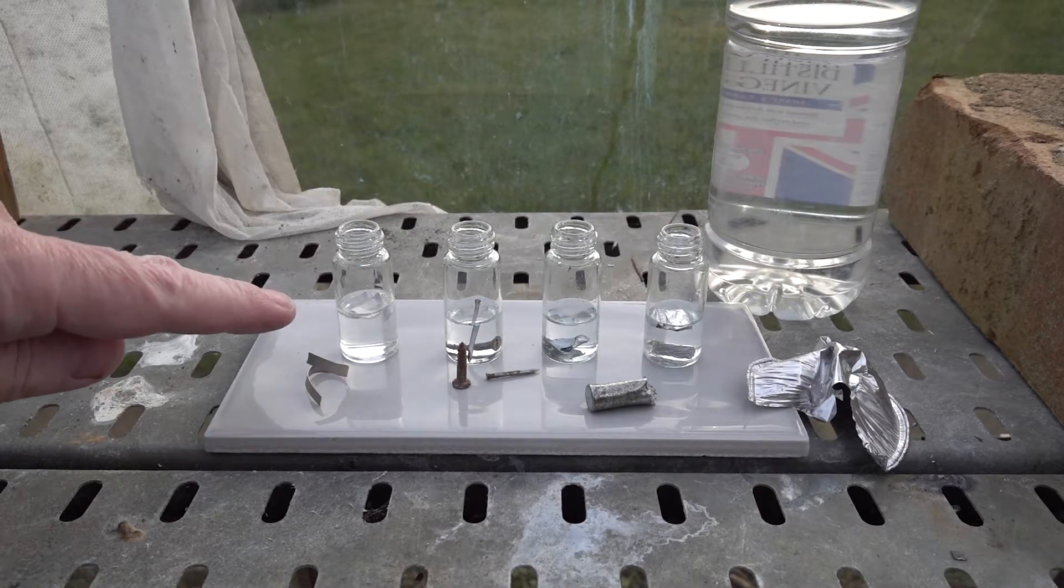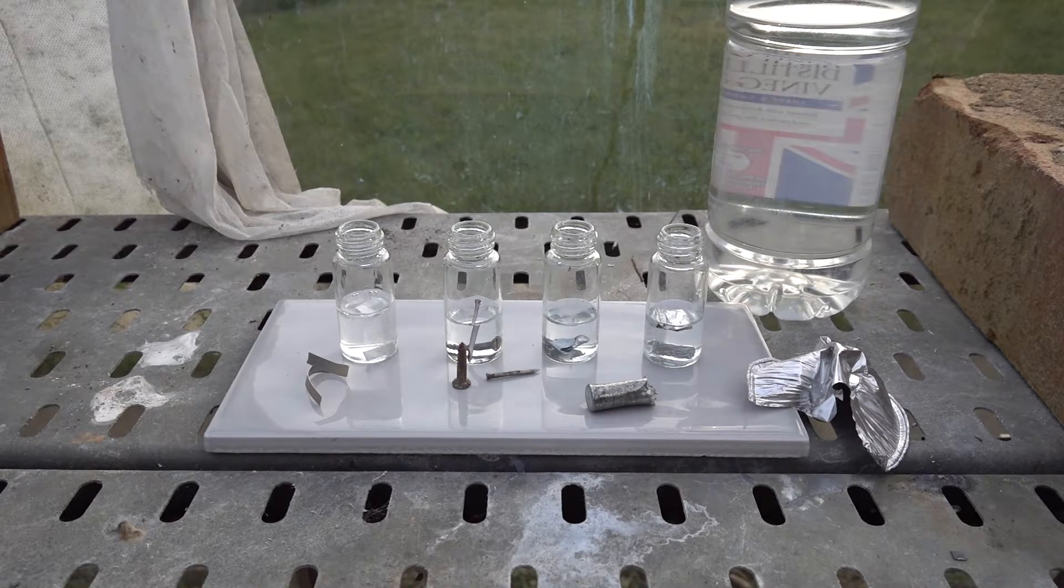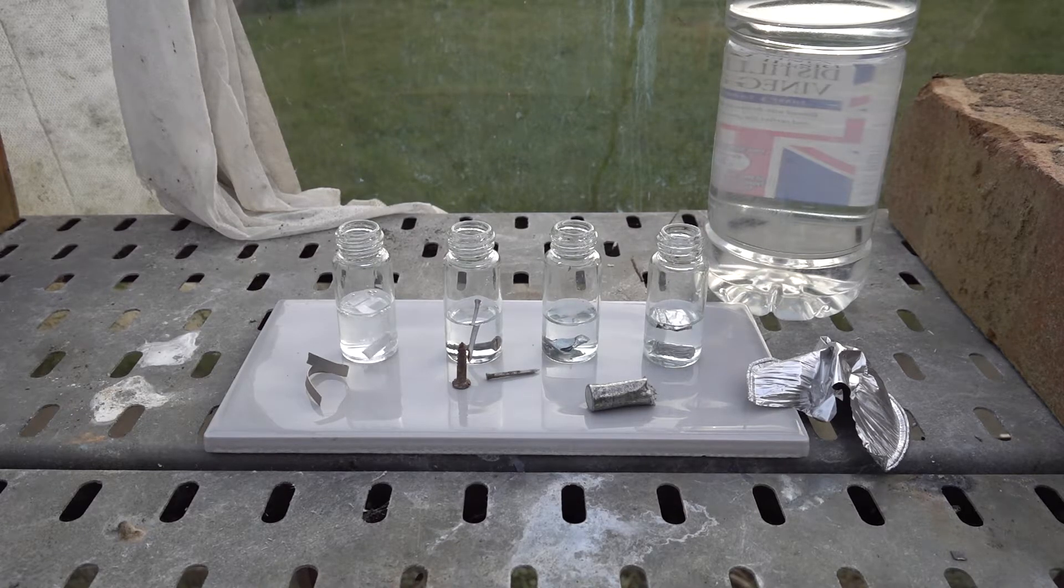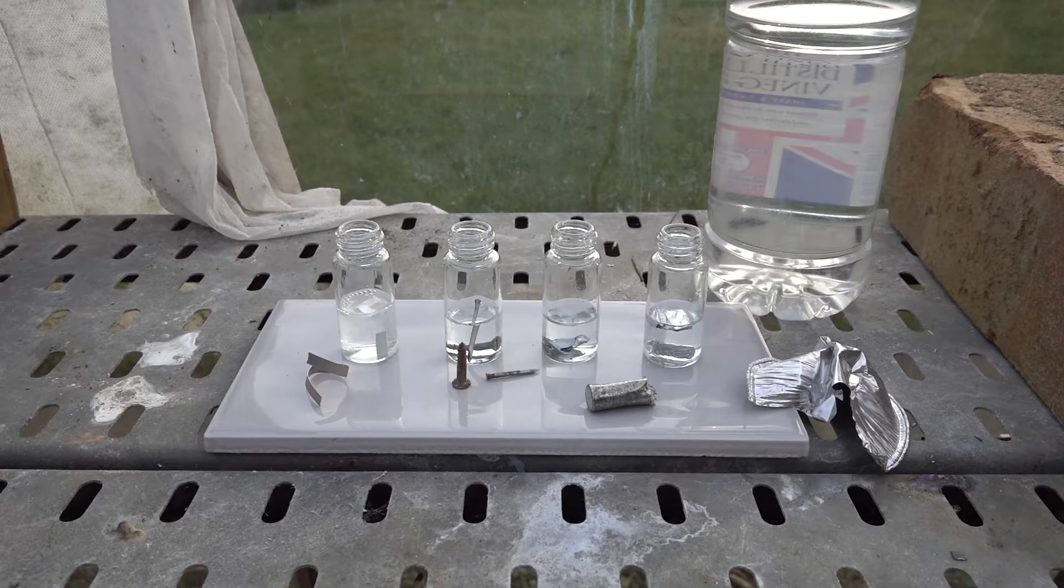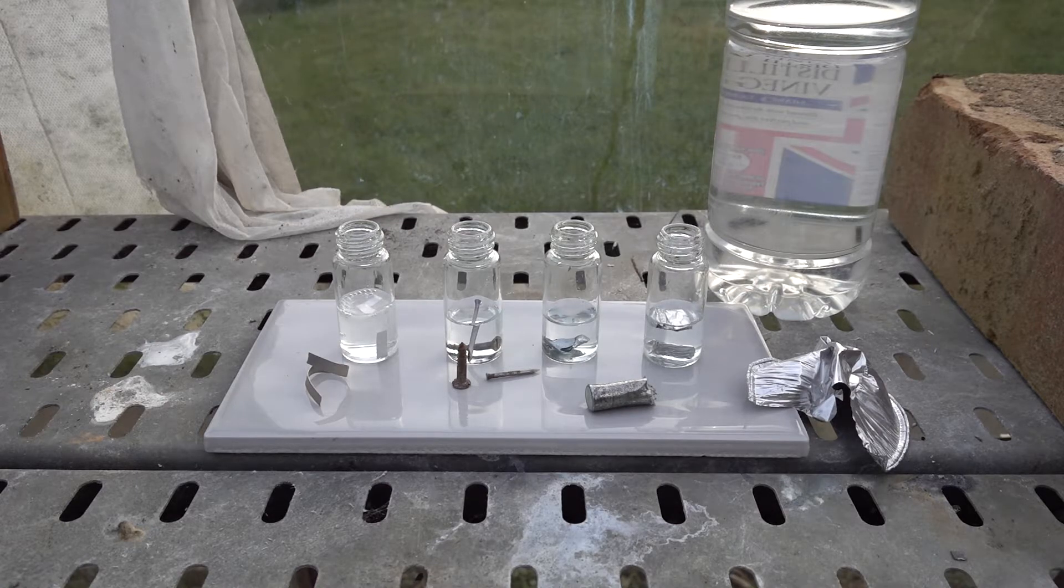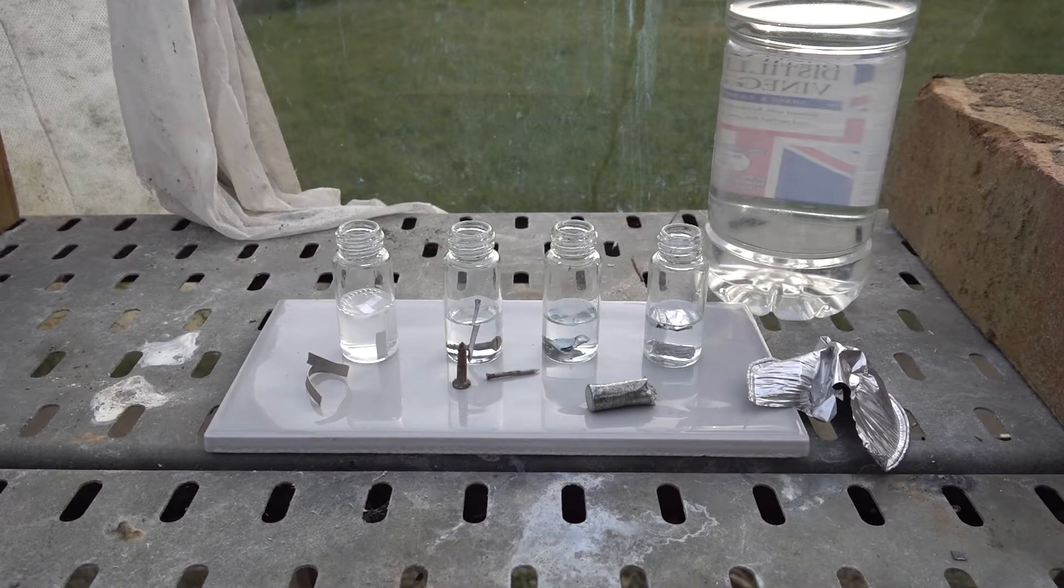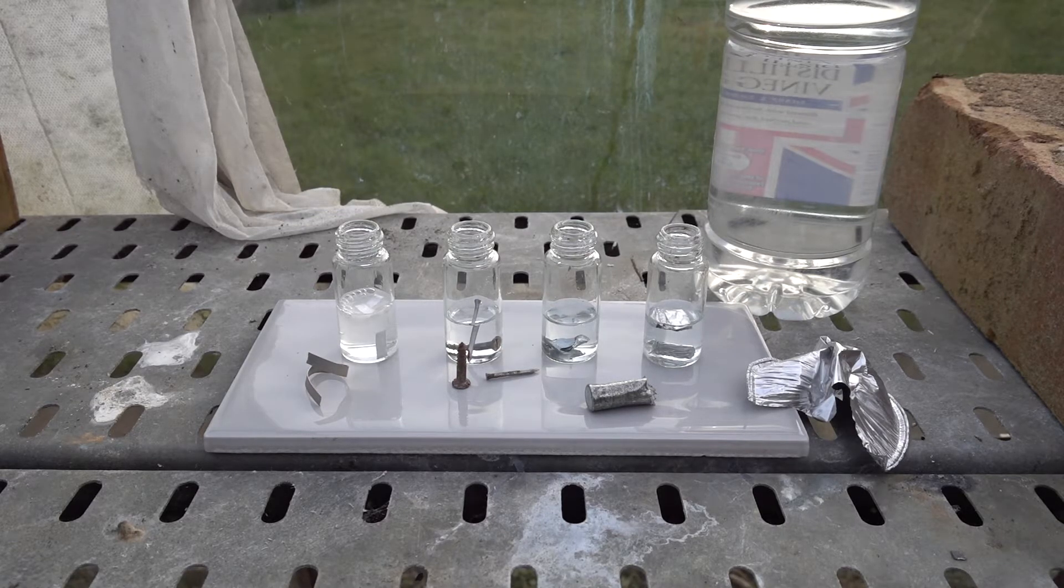Well, an instant reaction from the magnesium there which you can see bubbling and bobbing up and down at least one of the pieces. So magnesium, most reactive initially.